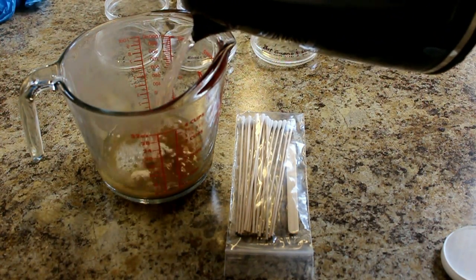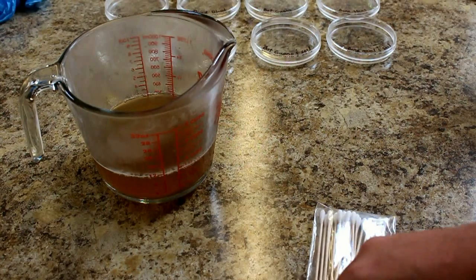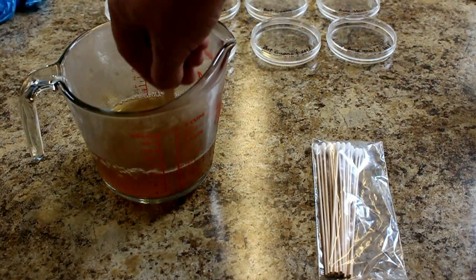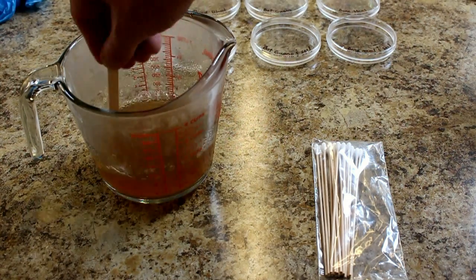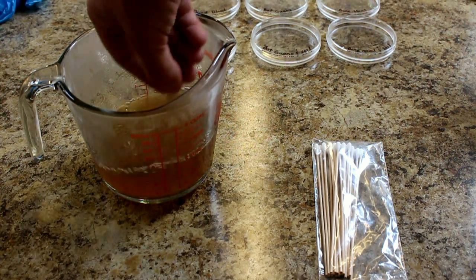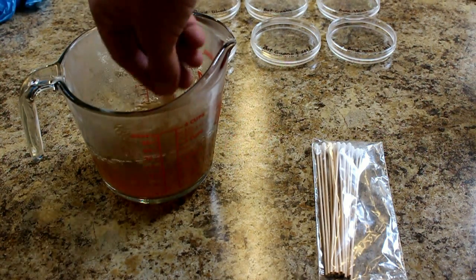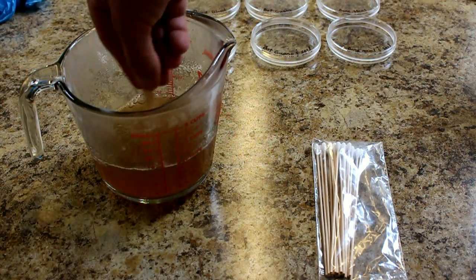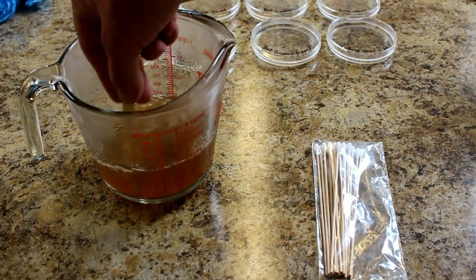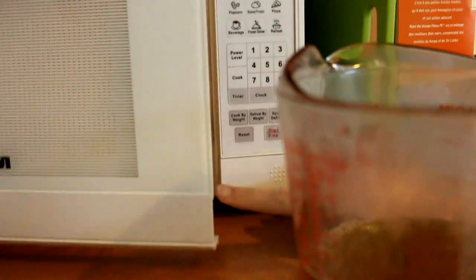Make sure we get 300 milliliters. Just a heads up — if you do this at home, this agar stinks. The goal is to get all of those agar cells to burst so we get all that gelatin in there. Normally the instructions tell you to put it in the microwave for two minutes, but we've got a terrible microwave here at the Remo office, so I'm going to use boiling water first, and then put it in the microwave just to make sure all of that agar is dissolved into the water.